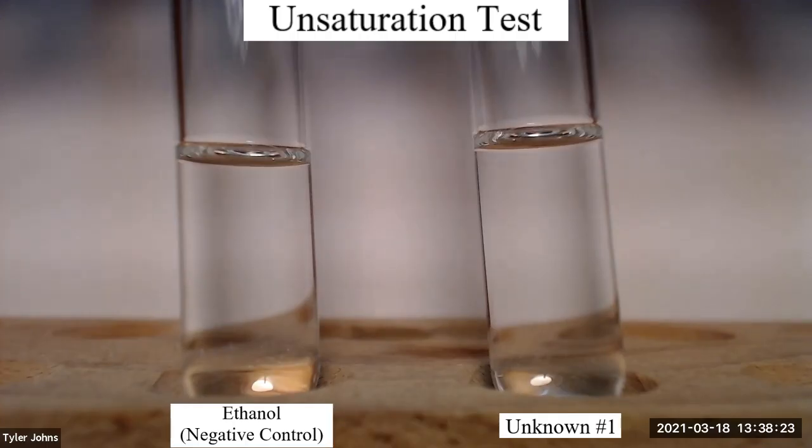We will now perform an unsaturation test for unknown number one.